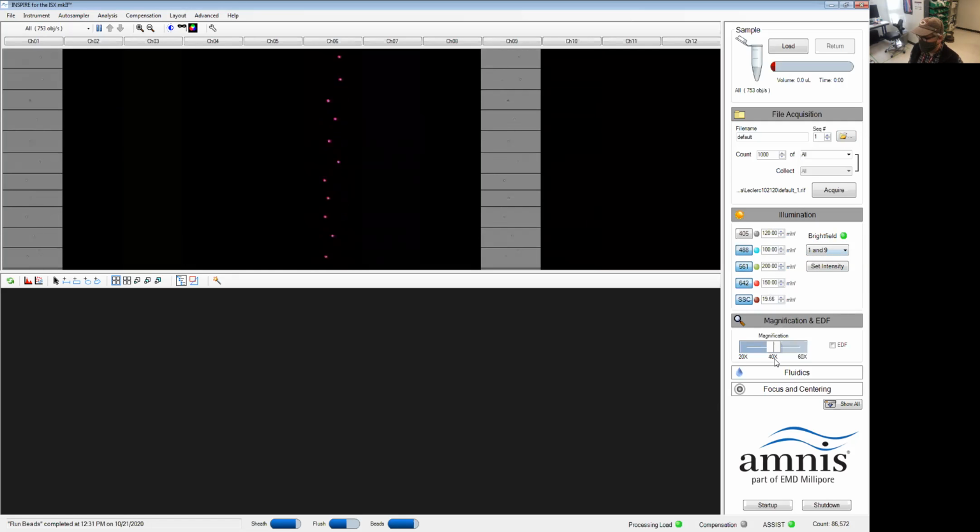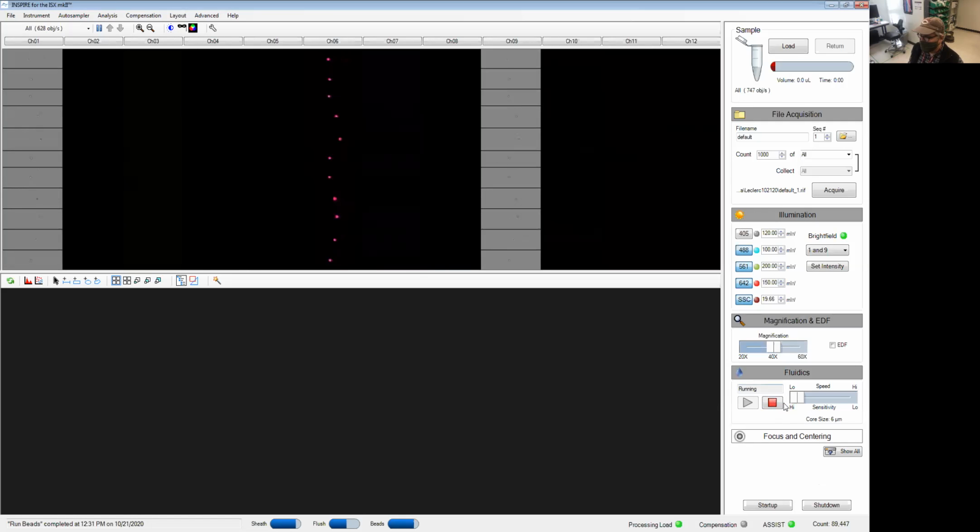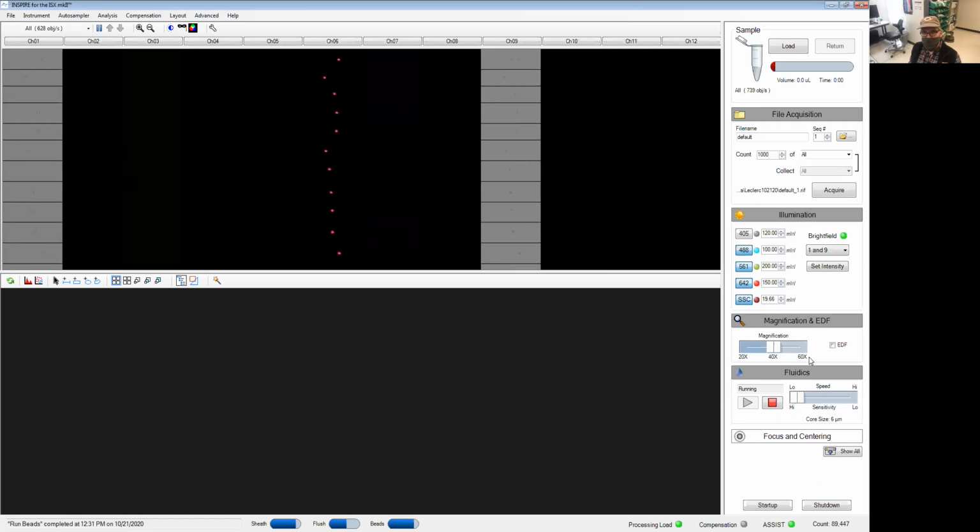Magnification is next, 20, 40, 60x. For this training, we'll use 40x. It really depends on what we're looking at. And the fluidics, I recommend the lower pressure. It gives you a sharper image in general, or more of the sharper image.